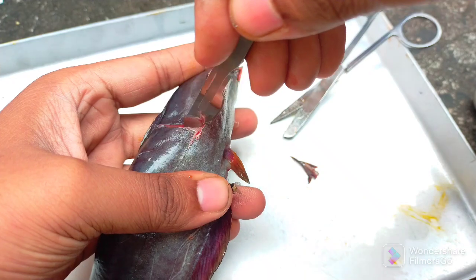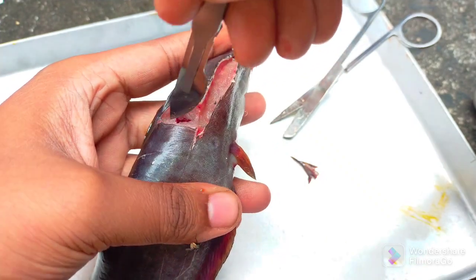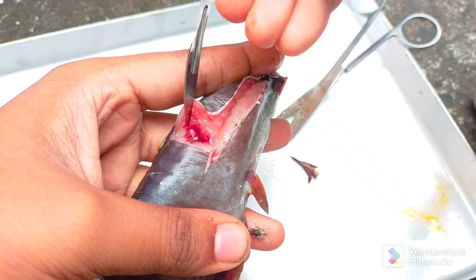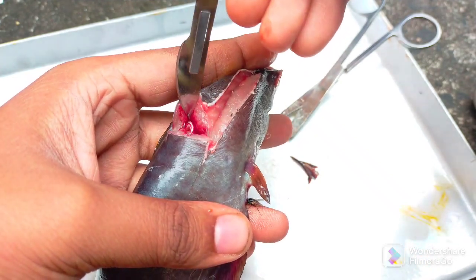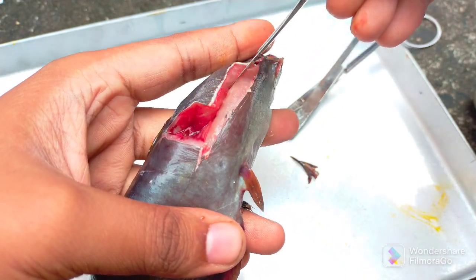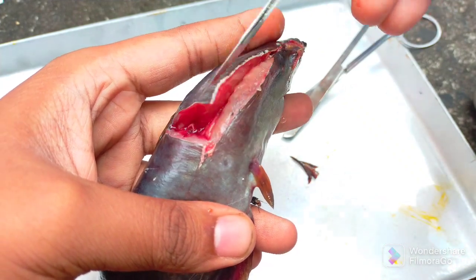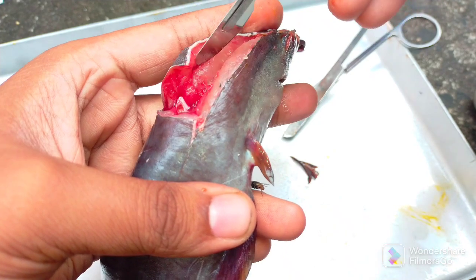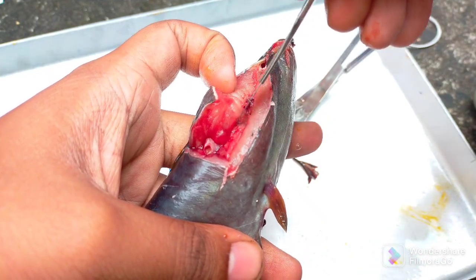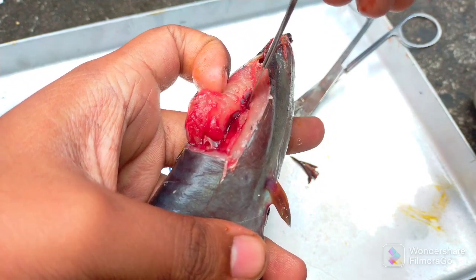Cut this part in this way. You can now see the branchial diverticulum — this pipe-like, tube-like structure. Slowly cut these muscles and remove them carefully.